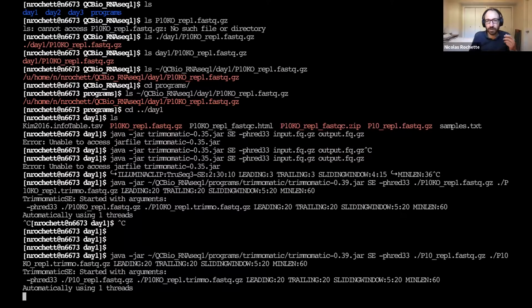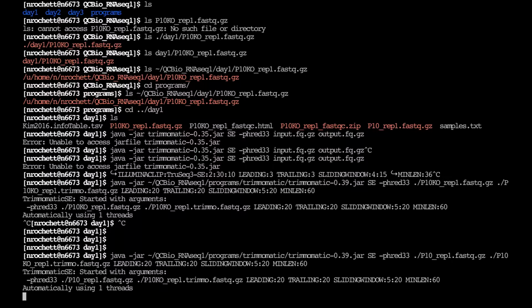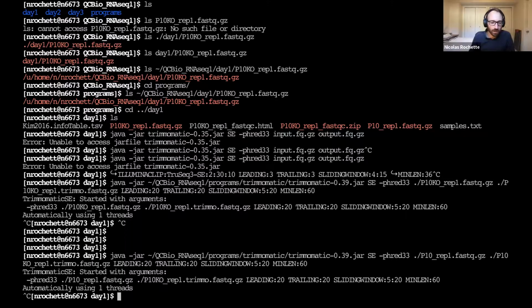And what just happened? Did anyone see the problem? You made the output the knockout file name. Yeah. So when I changed the command line, does it overwrite?